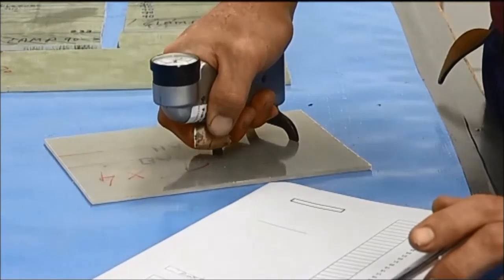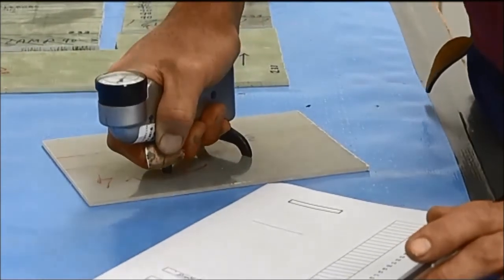I'm taking the readings from the gauge and recording them. I need to take 33 readings.